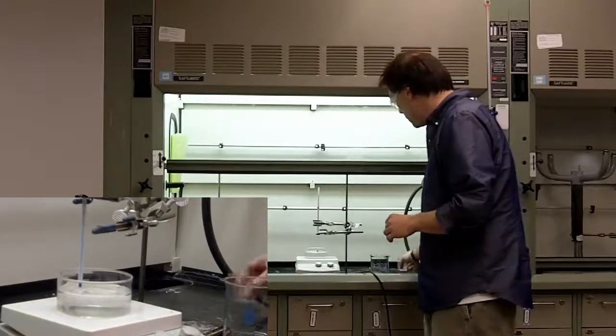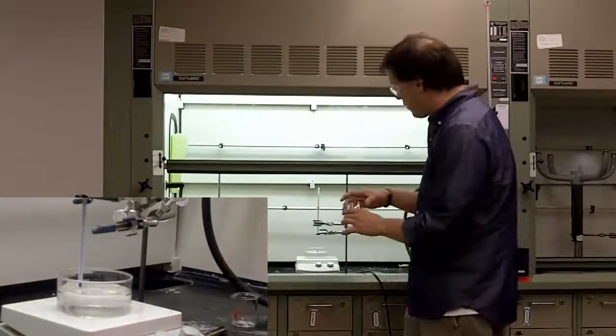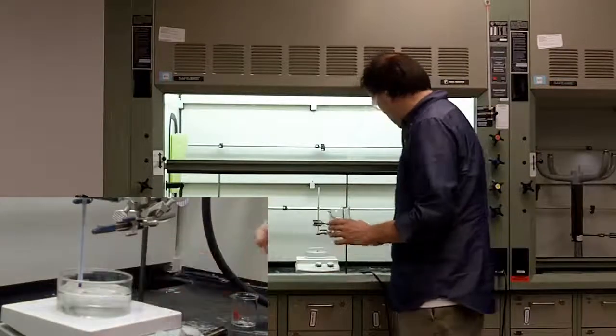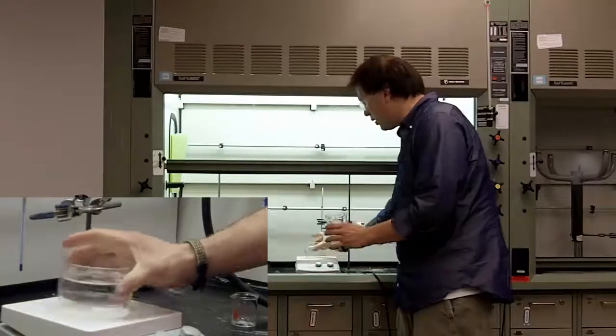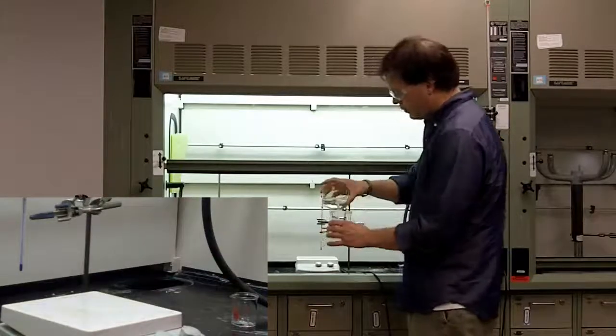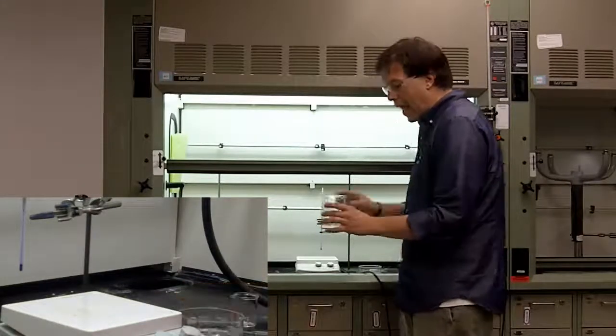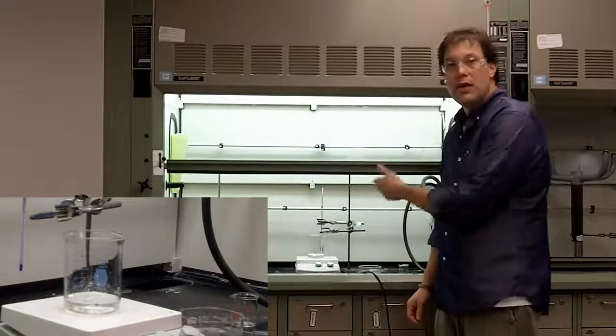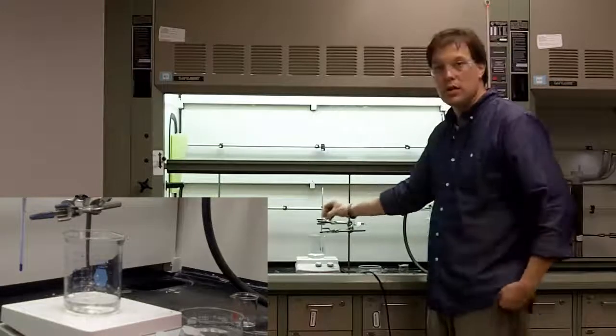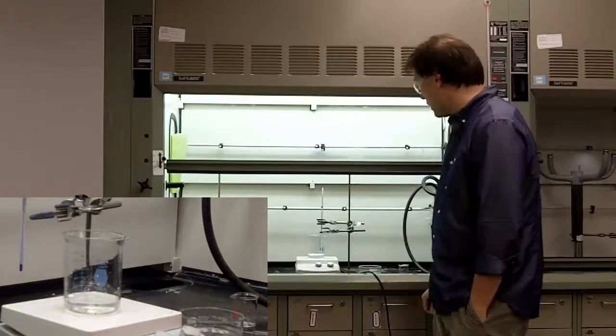Now, at this point, because of the fact that you have a large amount of water in here, normally it would be 20, 30, 40 milliliters of water, that acts as your control in and of itself and you can put it directly on there. And then you can go ahead and add water to it at the same time as you're heating it.